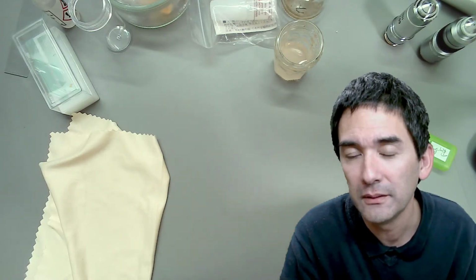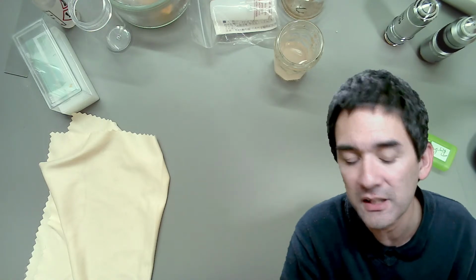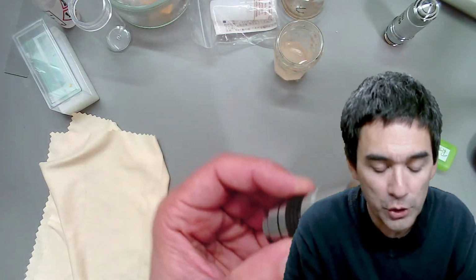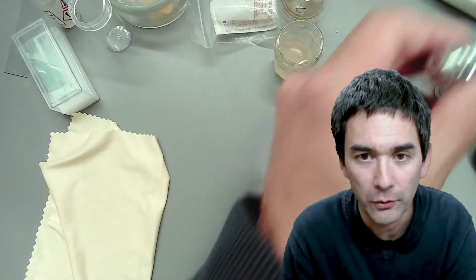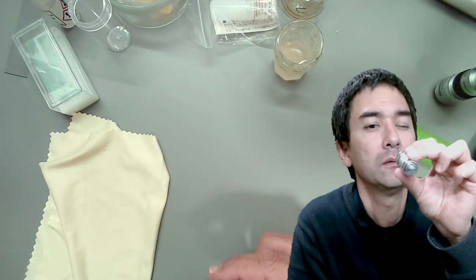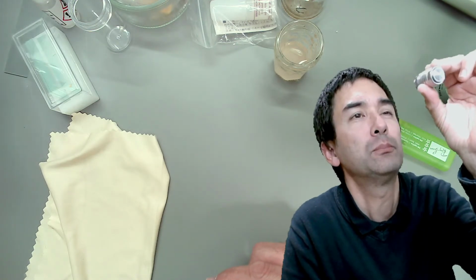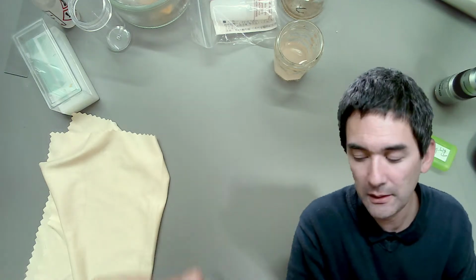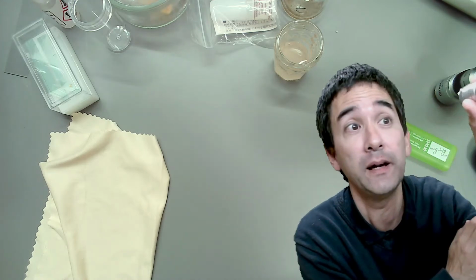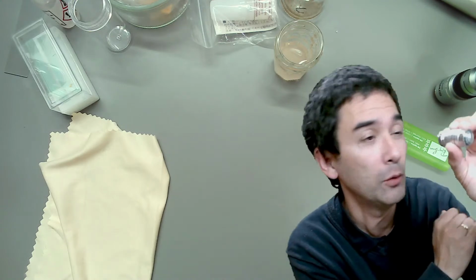So this is of course a problem. My oil immersion lens is showing permanently black spots. I recommend the following. If you want to check how clean any objective is, take it out and look at it from the backside. Hold it against some light or a bright background, or maybe use a magnifying glass or an eyepiece to magnify it. But actually, you can see it quite well if the objective is dirty or not.